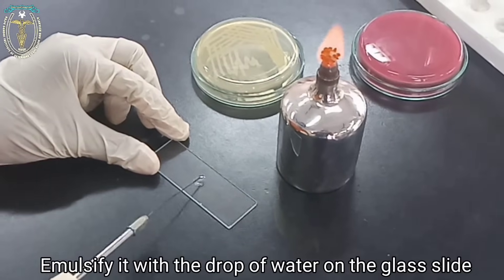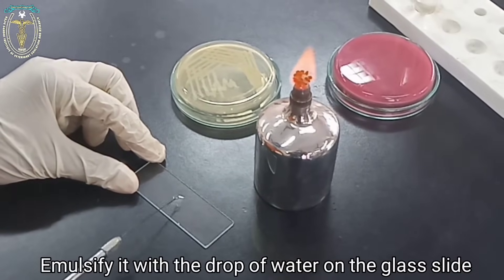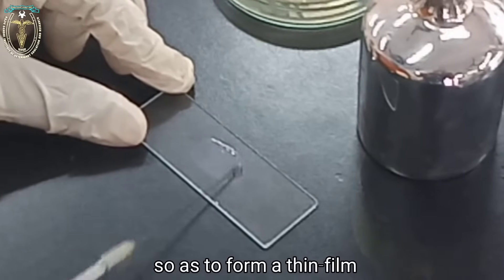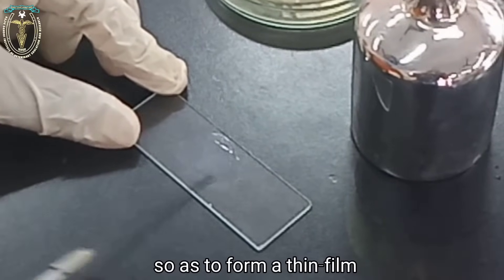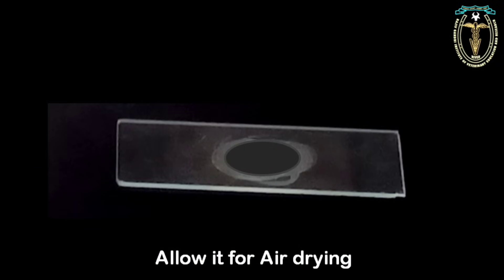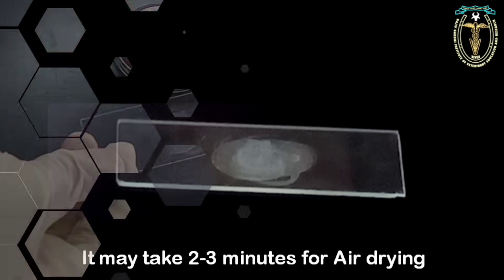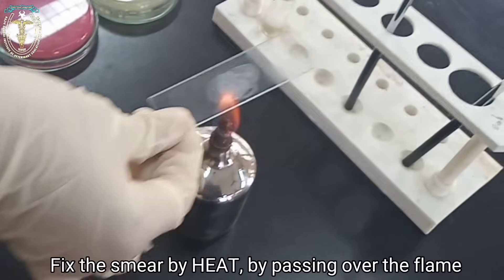Emulsify the bacterial colony with the drop of water on the glass slide. After emulsifying, spread the smear to the size of about one centimeter square so as to form a thin film. After spreading, allow it to air dry — it may take two to three minutes for drying.